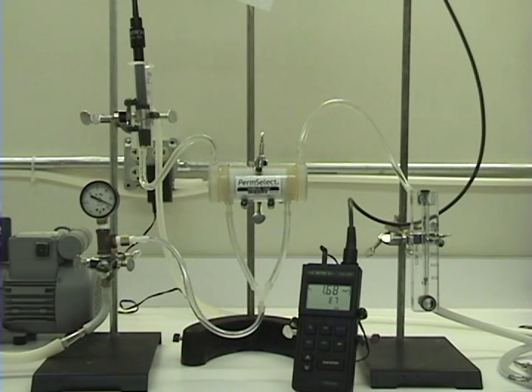This concludes our demonstration on how simple and straightforward it is to degas your liquid stream using a PermSelect membrane module.